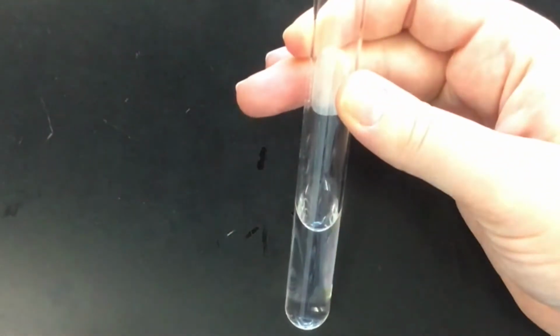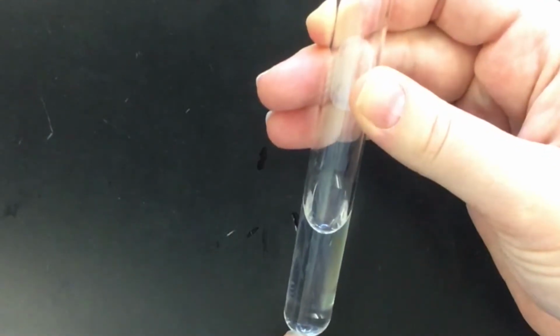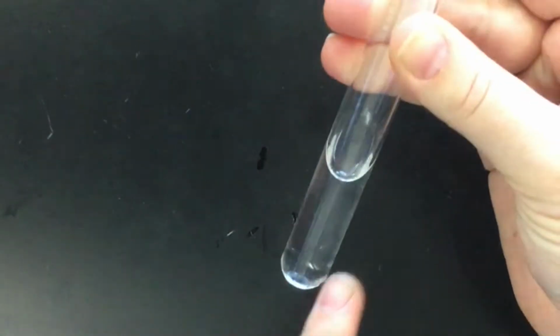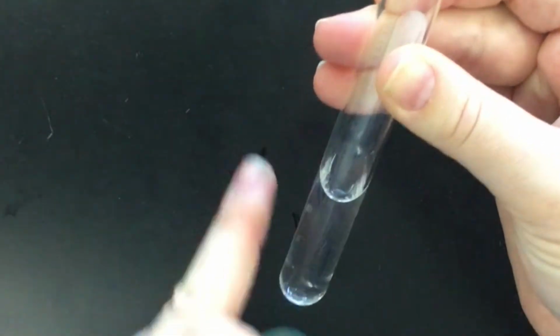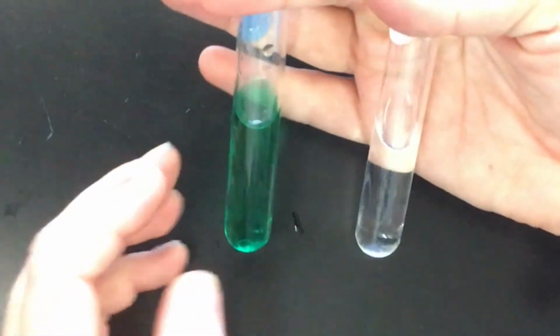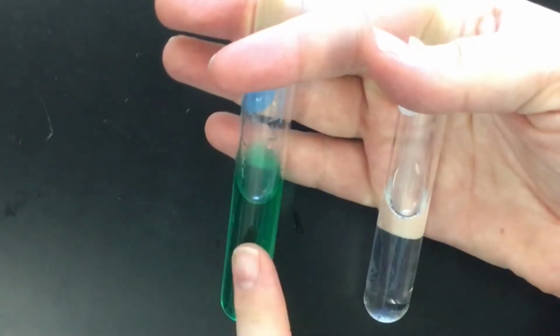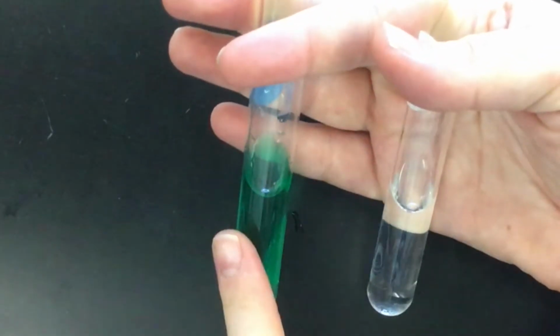I've done the same thing for my sodium carbonate, but you can see here that this has no color because white salts will dissolve and have no color. It's transparent, I can see right through it, and it's colorless. This means that this salt is soluble. So on a physical level, we can see what solubility looks like. But what does that look like on a molecular level? What has actually happened to the atoms?